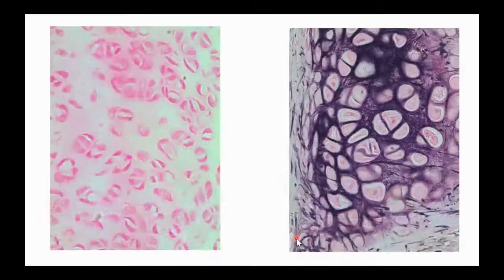If I still see those deer tracks, but I don't see purple, like you're looking at in this picture over here, I've got those deer tracks, but I don't have purple, this is an example of hyaline cartilage. Yeah, just like Elapina mentioned in the chat, this is hyaline cartilage.